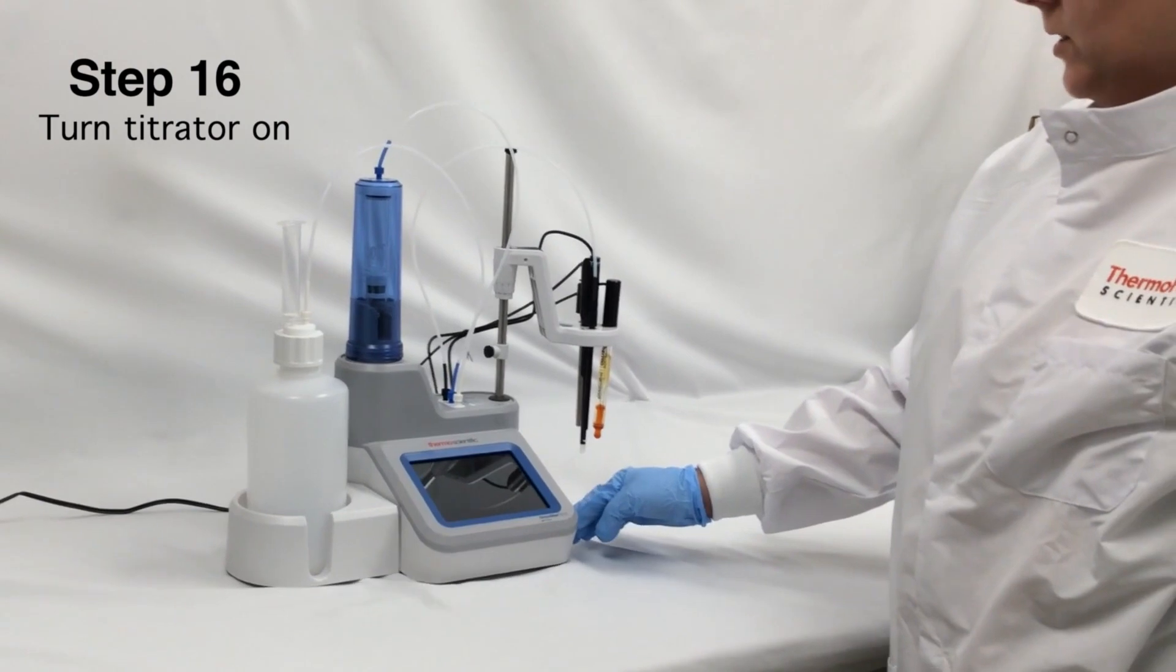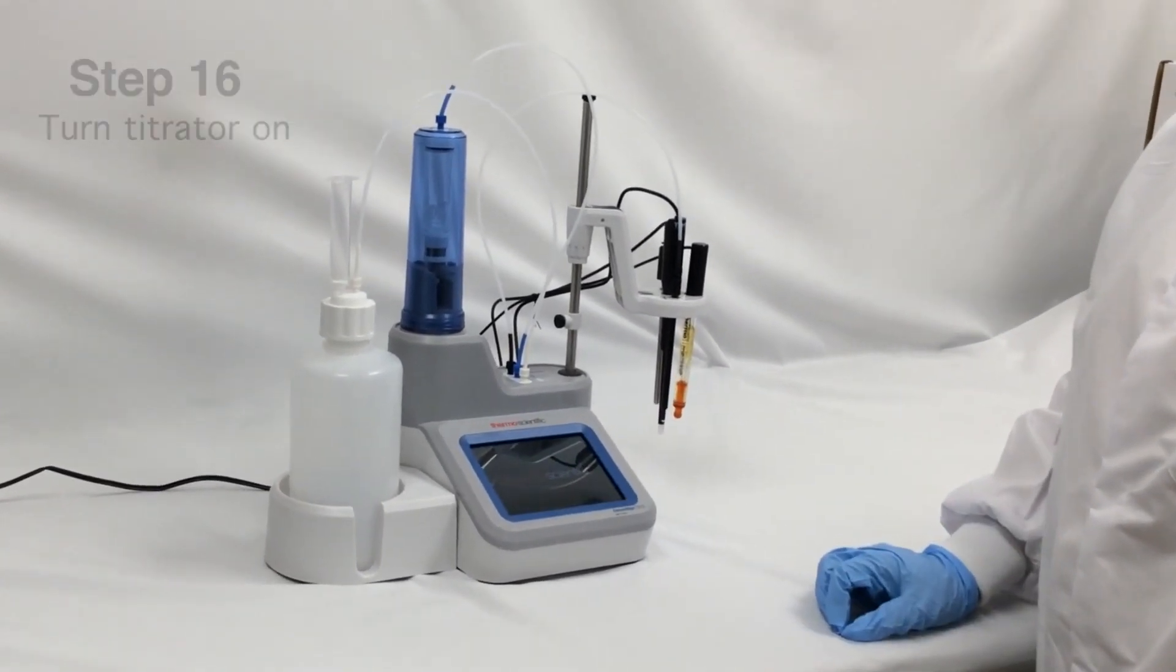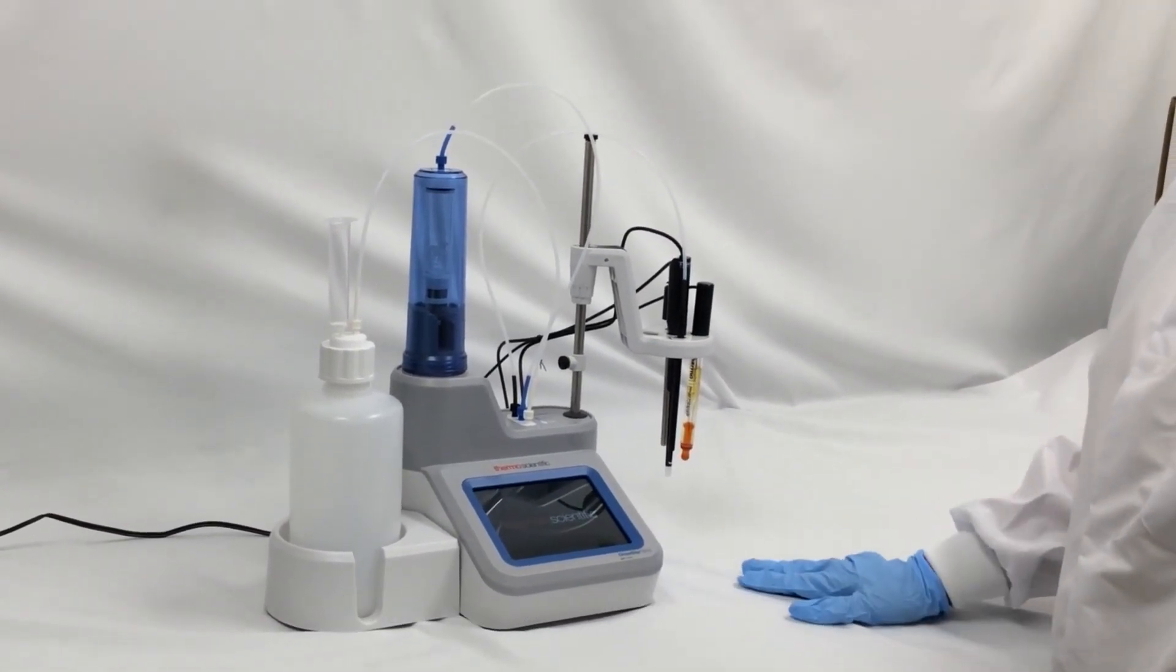Turn the titrator on. A splash screen appears, followed by the setup wizard, which will walk through the initial setup of the instrument.